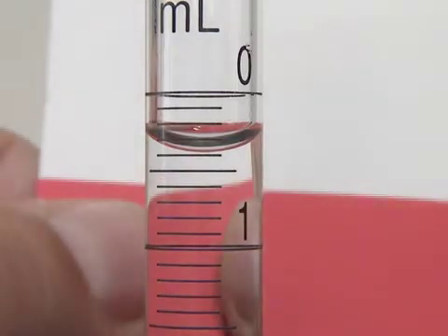This greatly facilitates reading the burette to the nearest one hundredth of a milliliter. Take the reading at the bottom of the lowest thin red line in the meniscus. The reading here is 0.38 or maybe 0.39 milliliters. But as you can see, we can easily read it to the nearest 0.01 milliliters.